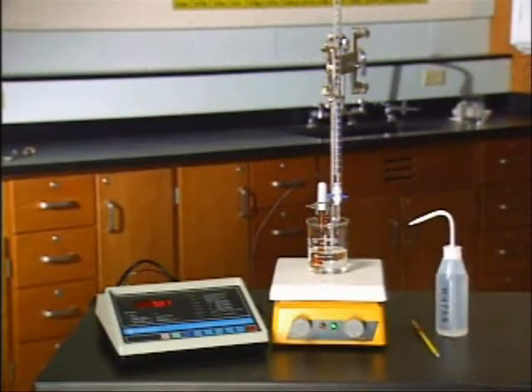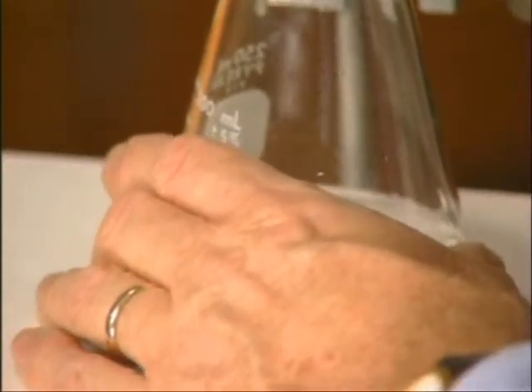A titration is a controlled acid-base neutralization reaction. 20 milliliters of hydrochloric acid of an unknown molarity is added to a flask.